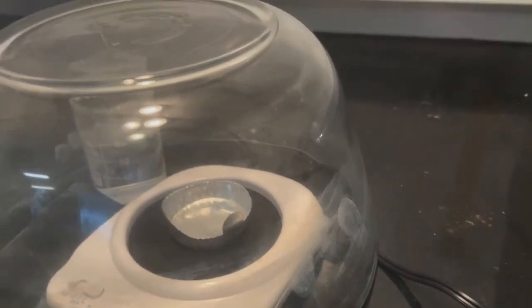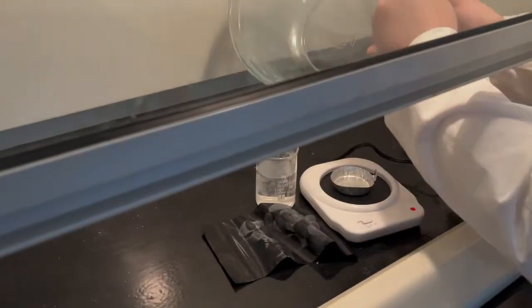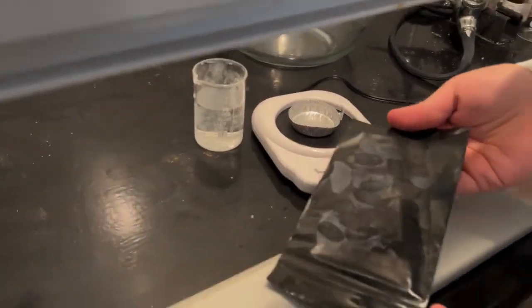Allow time for the cyanoacrylate to evaporate. Development of white prints on the fuming chamber indicates that fuming has likely completed. Once complete, remove the fuming chamber, turn off the heating element, and obtain the developed fingerprints, which should now be visible.